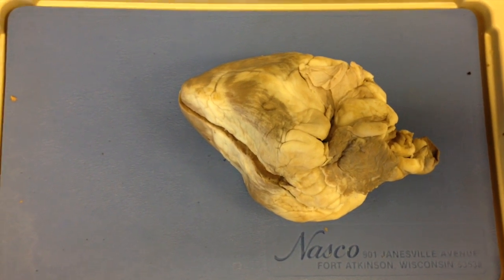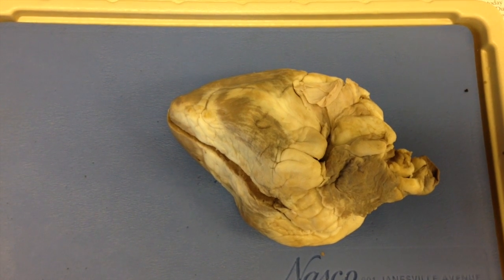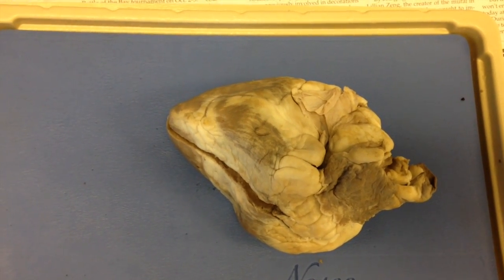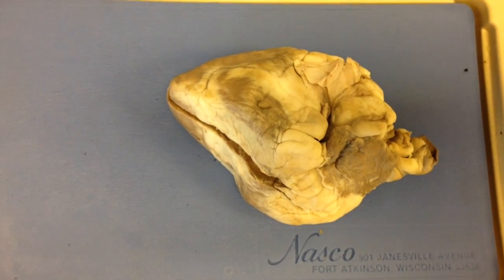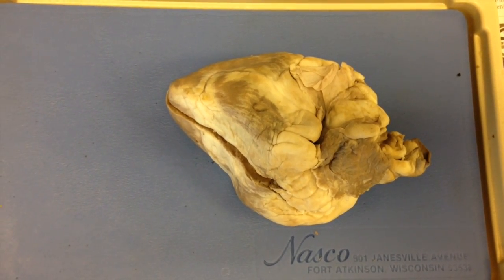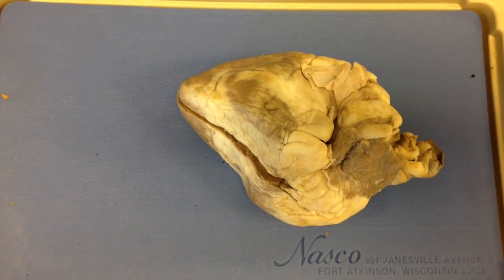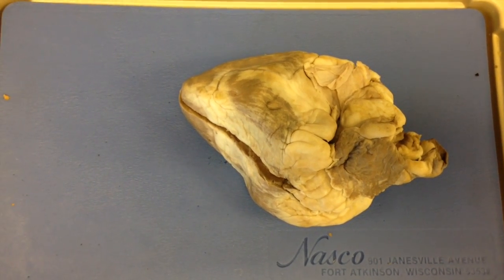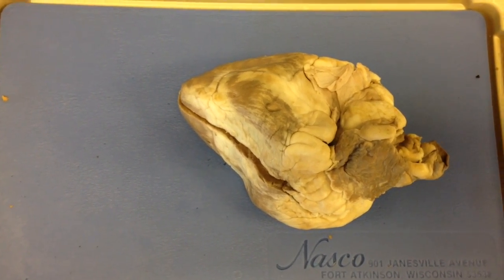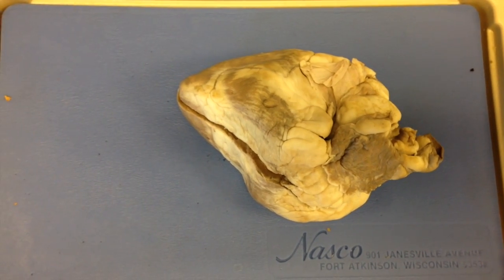So these are the main layers of the heart: the pericardium, the epicardium, the myocardium, and the endocardium. The pericardium is made up of a double sac of serous membrane, and its purpose is to secrete a fluid that lubricates the heart and reduces friction. The epicardium is basically the same as the visceral pericardium, which makes up the heart wall. The myocardium is a layer that contracts and pumps the heart. And the endocardium lines the chambers of the heart.